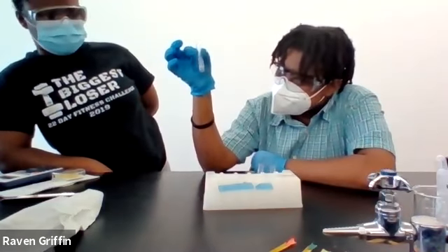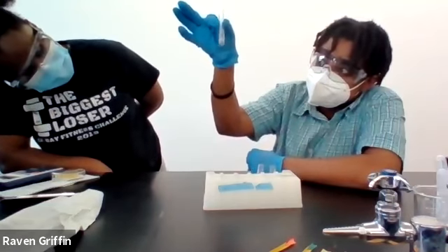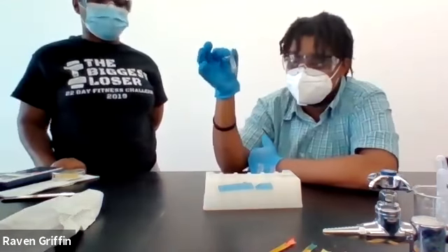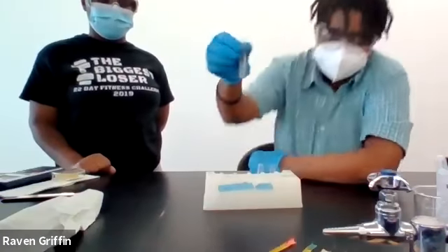And with the addition of HCl, it's fizzing. Most of the solid is gone. Just a little piece in there and it is still bubbling. And I can hear it bubbling. The whole solution kind of has that gray color now.